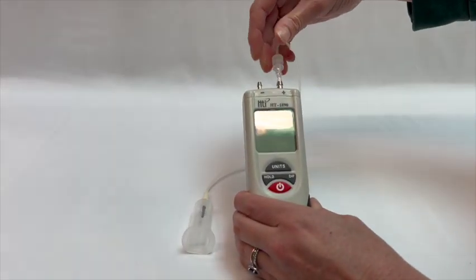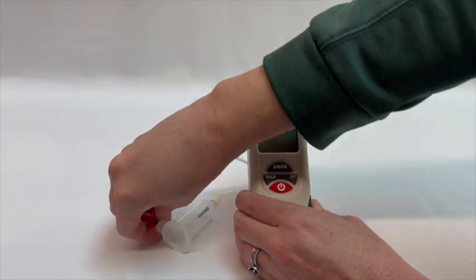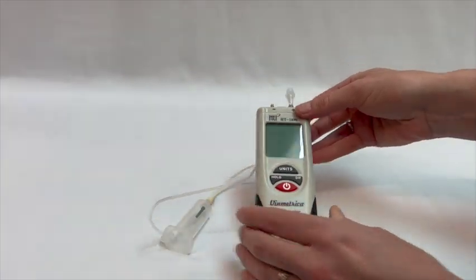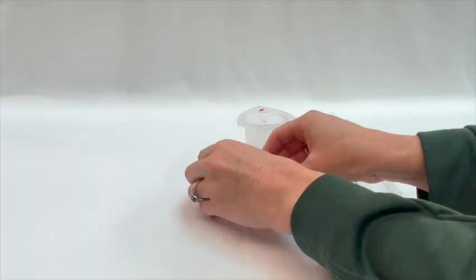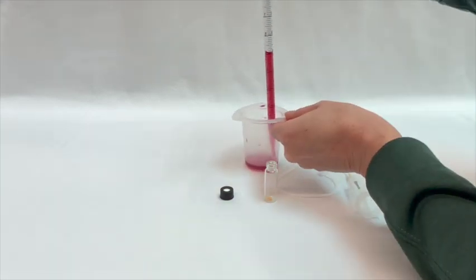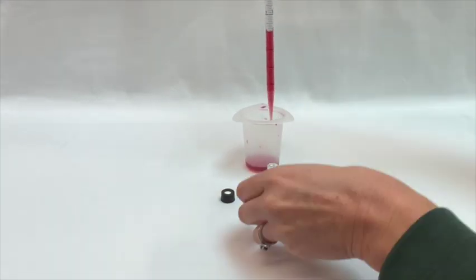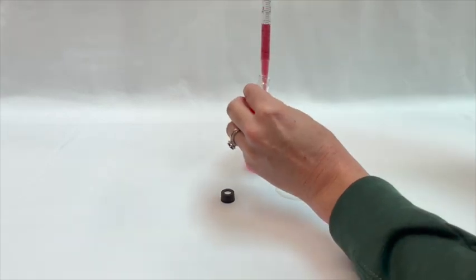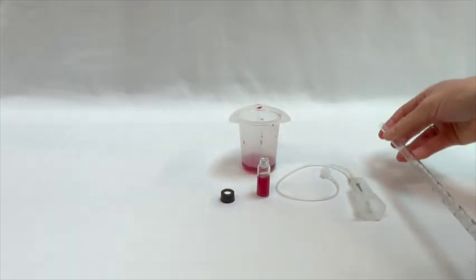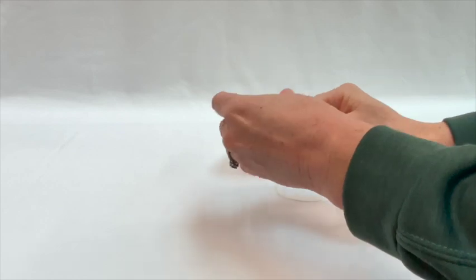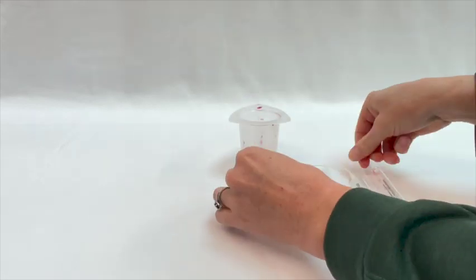Make sure your vial insertion assembly is disconnected from the instrument before proceeding. Now we are going to transfer 3 ml of our wine sample mixture into one vial with the preloaded biopressure agent. Immediately cap the vial. Do not mix it at this point.